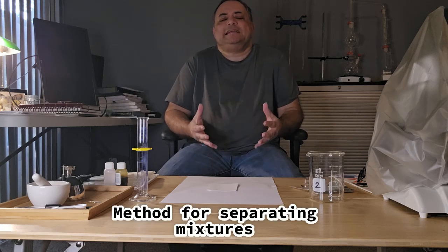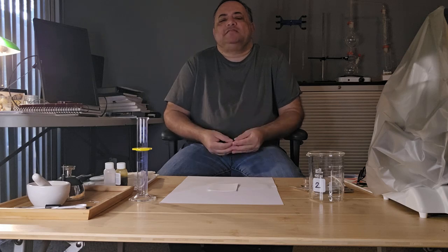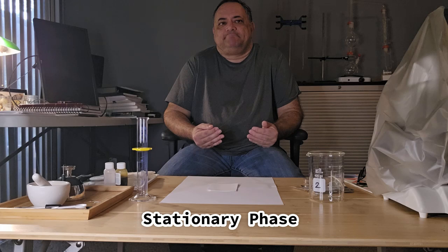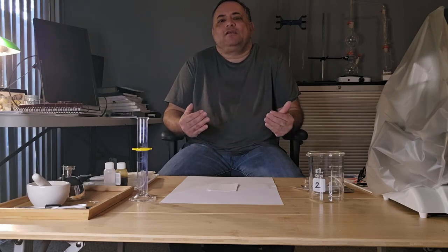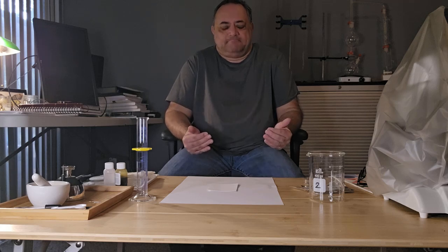Chromatography basically is a method for separating mixtures. In chromatography, a mixture is dissolved in a solvent, a mobile phase, that passes through a stationary phase. During the passage, various components of the mixture selectively adhere to the stationary phase with greater or less affinity, separating the components physically across the stationary phase.